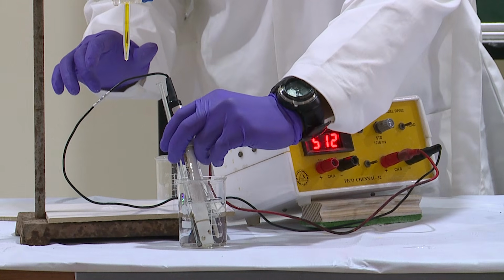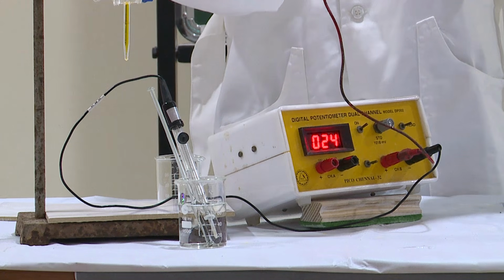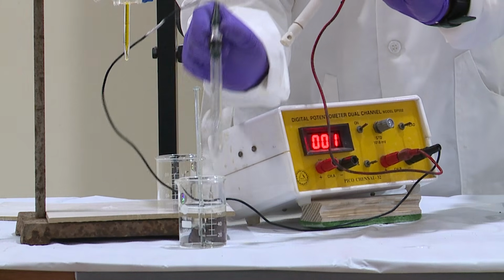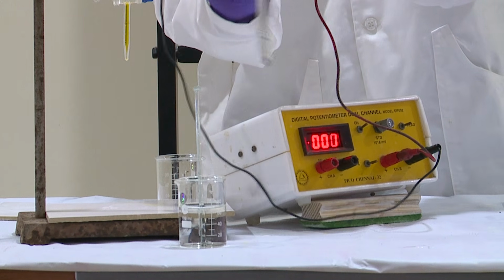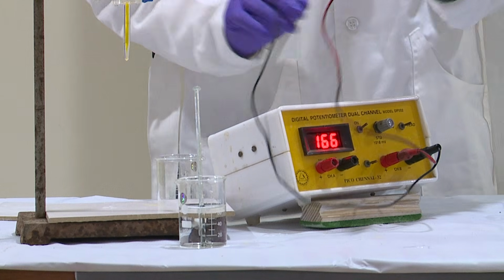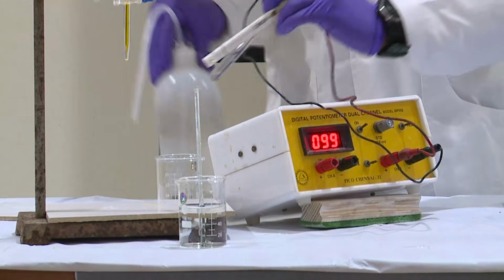There are two electrodes which we are going to use. One is the platinum electrode, the place where we are going to perform the oxidation or reduction, the redox reaction, and a reference electrode, which is the standard calomel electrode. You are going to measure the potential of the reaction occurring at the platinum electrode with respect to the reference electrode. Rinse both of them in distilled water prior to keeping them in the sample solution.